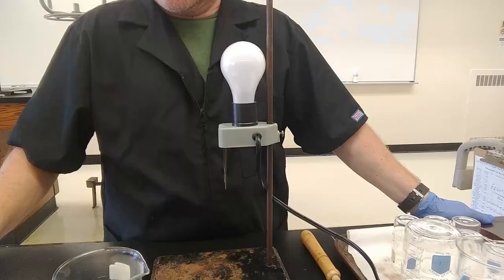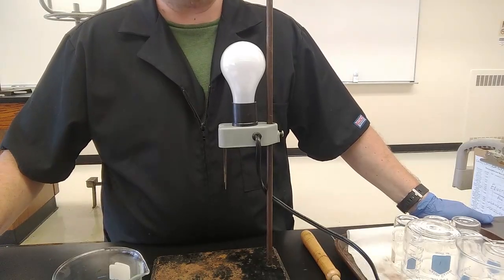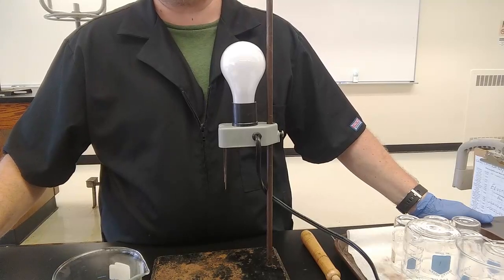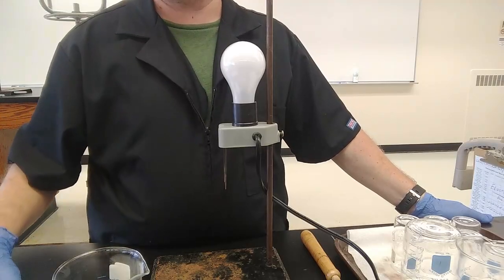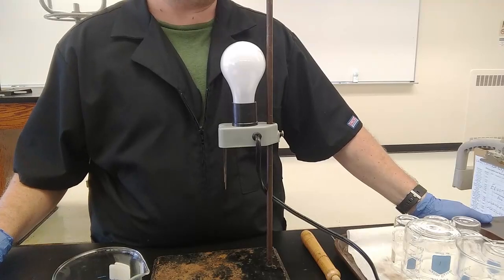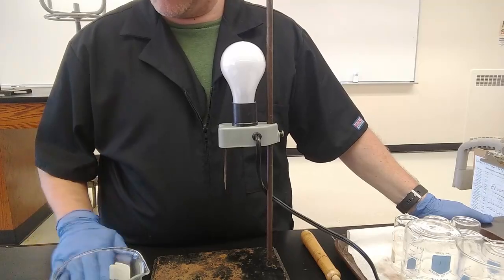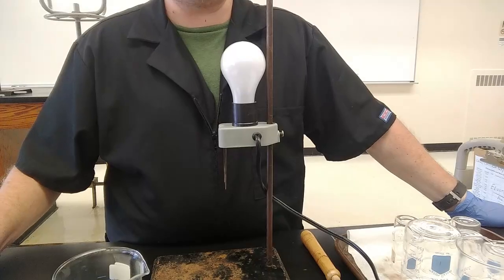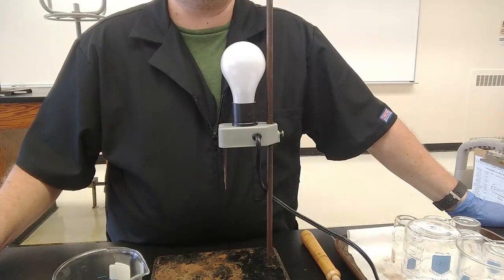Experiment 11. The electrical conductivity of aqueous solutions, electrolytes and non-electrolytes, strong and weak electrolytes or non-electrolytes. What do you do when it's 8,000 degrees in the lab? Add in the possibility of electrocution. So that's today's experiment. Remember the definition of what an electrolyte is from the lecture, and that is something which, when dissolved in water, big part of the definition there, conducts electricity.